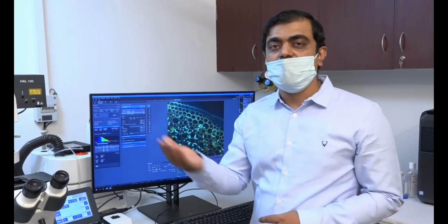You can do it from here. So you see 96%, this is about to get completed. The DAPI. So I have DAPI, FITC all together. So you will see here red, green as well as blue, all the 3 channels I have got.